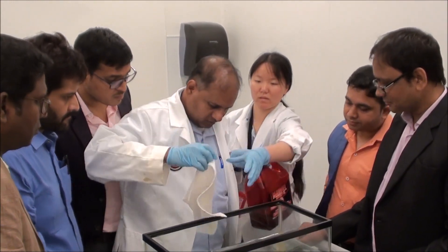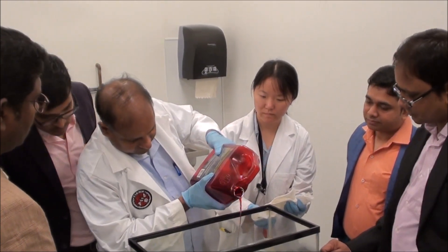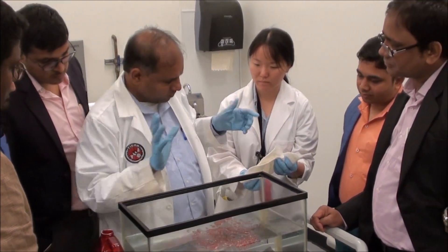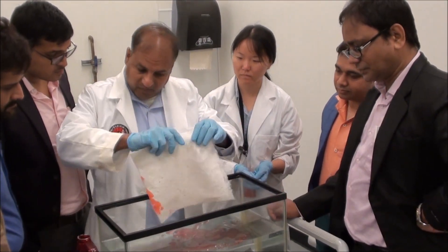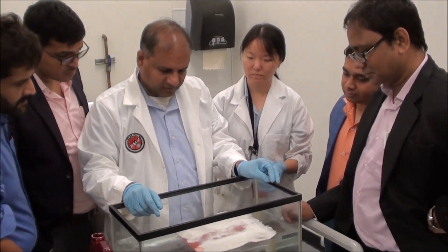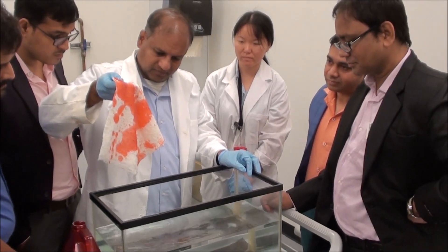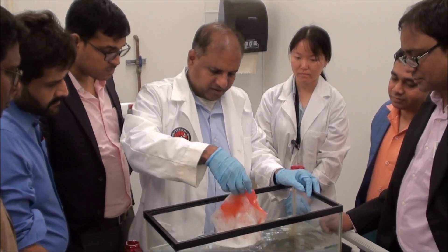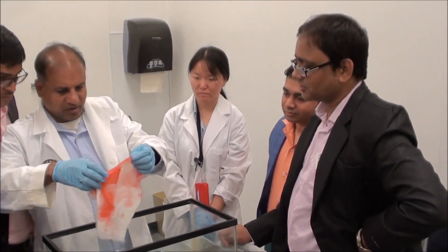Now, come on over. Put this now — oil. This is one example of finding a new market for cotton. It won't take water, but it will instantaneously pick up the oil. See — clean. Water won't sink, whereas oil is absorbed — clean. That is how you create new products.